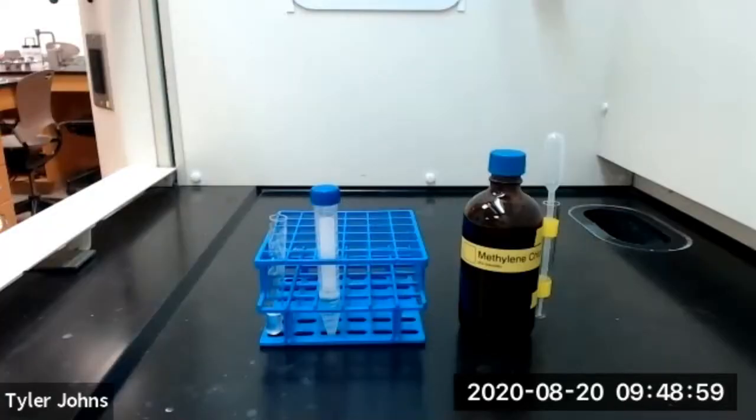We'll now repeat this extraction two more times using two milliliters of fresh methylene chloride each time.